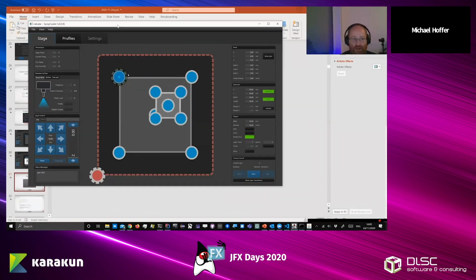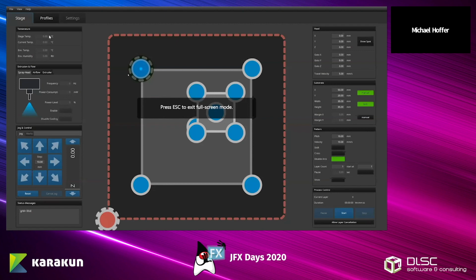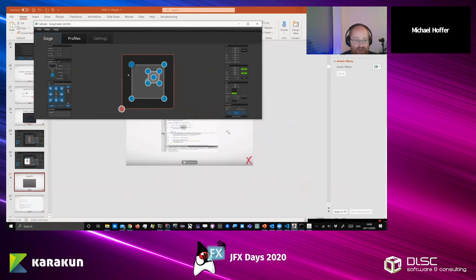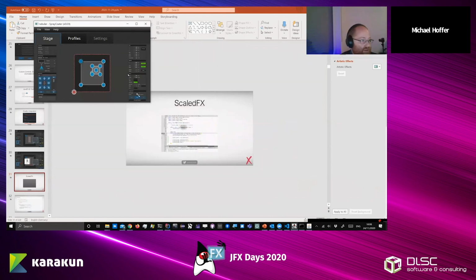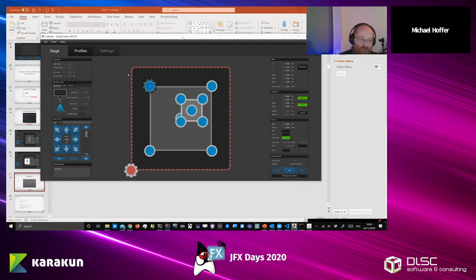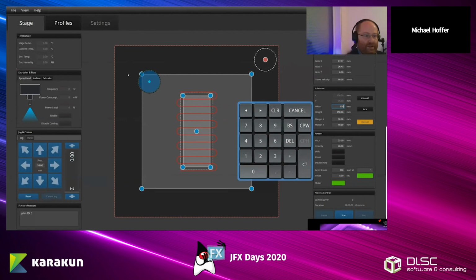Here you can see it. So the application is smaller, but the buttons are also smaller. If I go full screen, you see the buttons increase in size, but they still keep their layout. And the only thing the application might do is add some weird borders if you have really untypical screen sizes, but it will always work, even if you make it extremely small. So if you have a custom display built into a machine, we can adjust the application a little bit, but for basically all the tabs here and boxes, we can keep everything as it is and just give users a familiar layout.